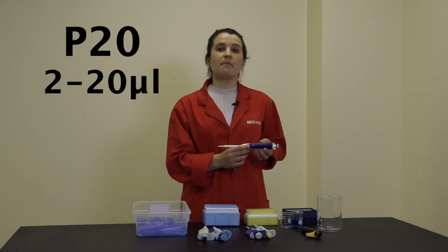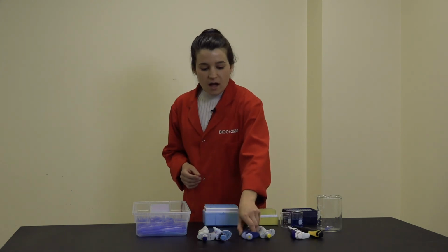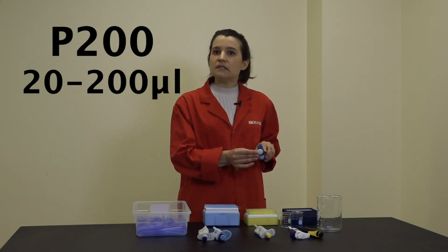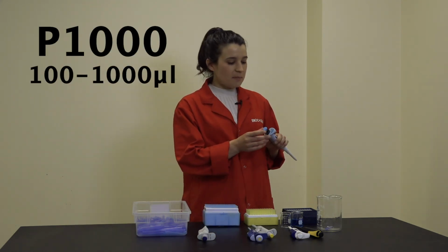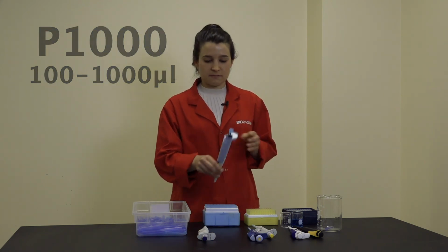This is capable of pipetting anything from 2 to 20 microliters. Here I have a couple of P200s, which are capable of pipetting anything from 20 to 200 microliters. And finally, I have a couple of P1000s capable of pipetting anything from 100 to 1000 microliters.